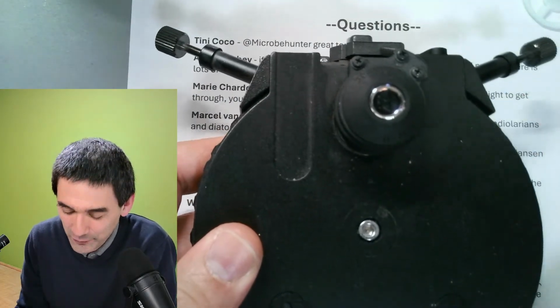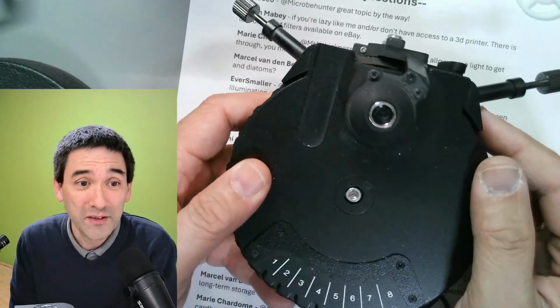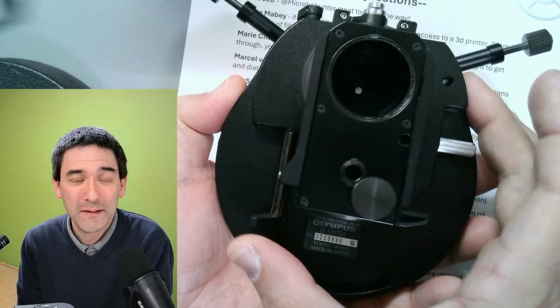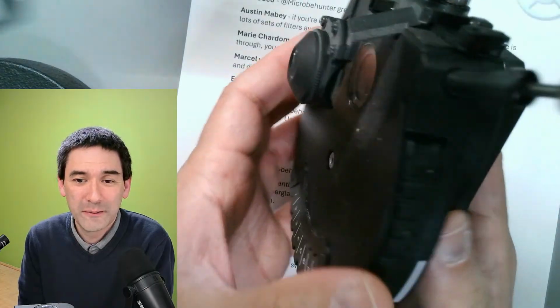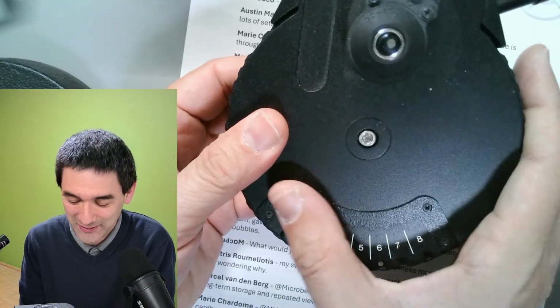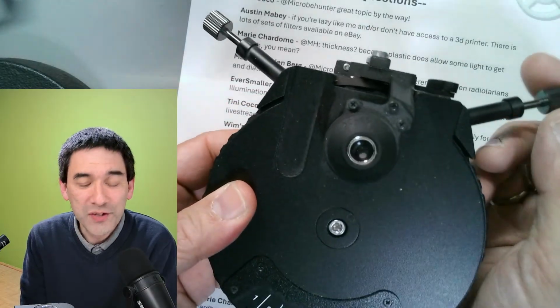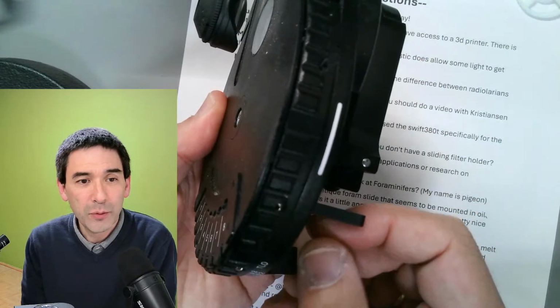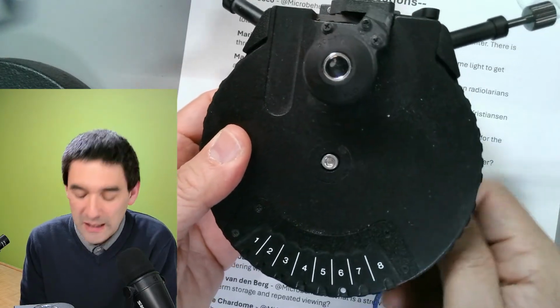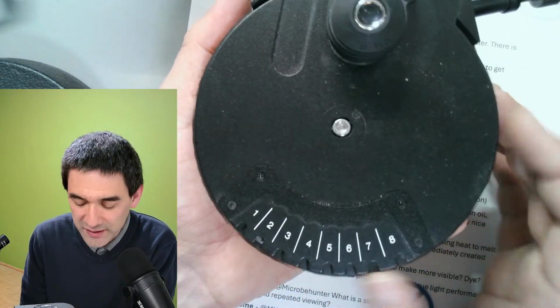Wow, this is my Olympus microscope's condenser. Actually, it's the first time I'm showing this to you. This is how the condenser looks like. I lowered the stage first, otherwise you can't get it out. Those knobs are for centering it. There is a lever that you can flip over here, and you can swing out this part here, so that essentially it's for the 4 times. And what I have to do for the different DIC settings is rotate this here.